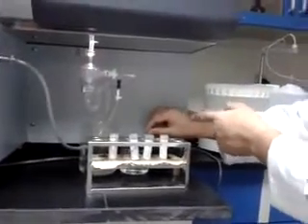I clean it and let it absorb some de-ionized water to clean the pipe, then insert it after some minutes into the new sample. It takes time to fix the pipe in properly — otherwise it will come out, so it takes time to fix.